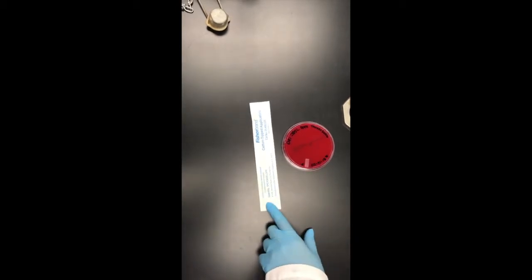So for the throat swab, you're going to need a blood agar plate, which I've labeled, and then a sterile swab. And I've already swabbed my throat.